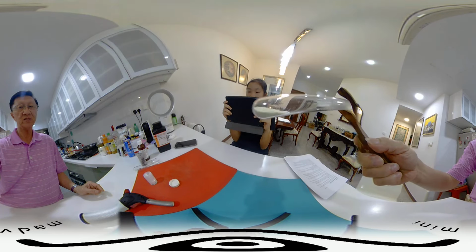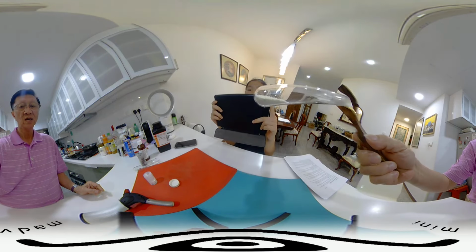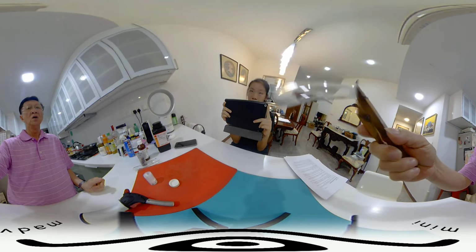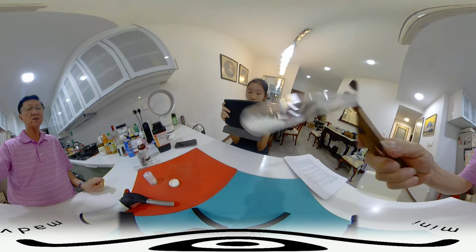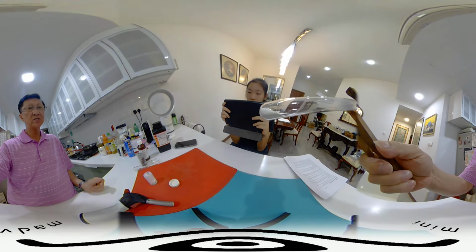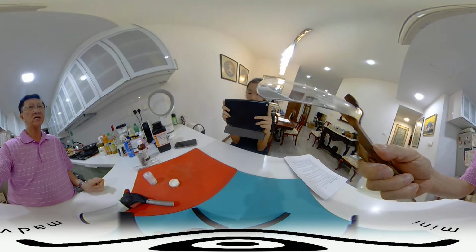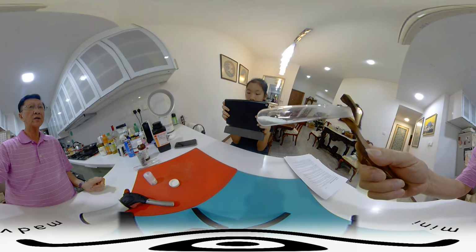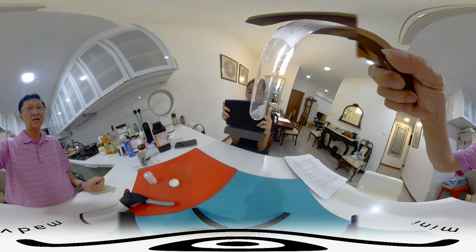Bring your tablet a little bit nearer. Can you see it's changing to white? Yeah? So that itself is not a reaction. So a change of color often is related to thermal decomposition, is a reaction for most changes of color, but in this particular case, a change of color is not a reaction, which means that zinc oxide is yellow when it's hot, and when it returns to room temperature, it is white, like that.